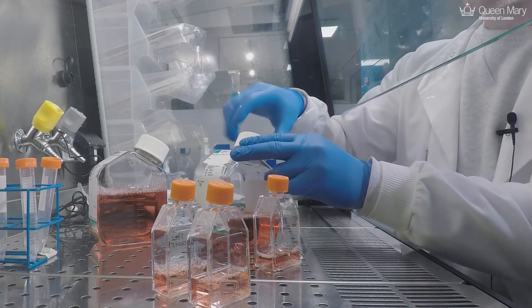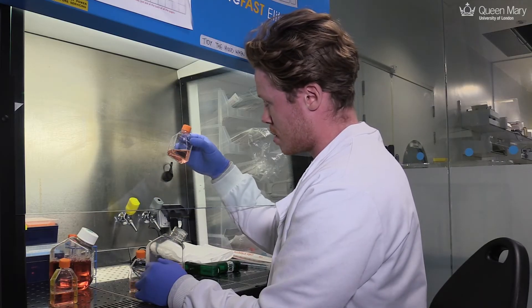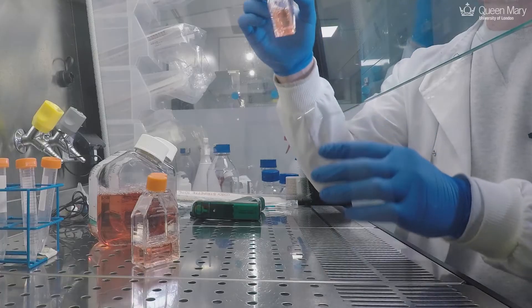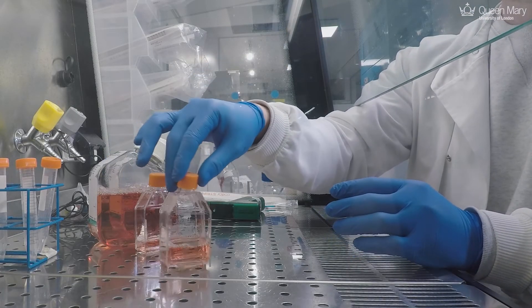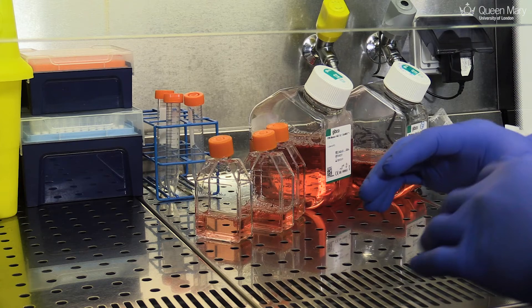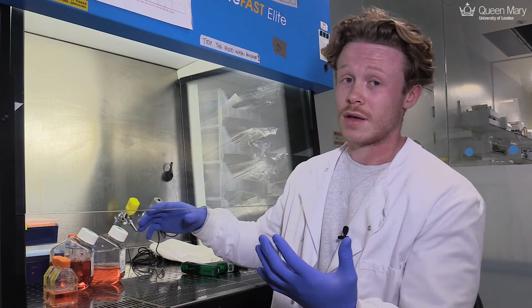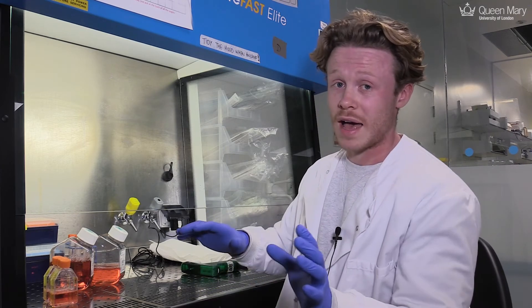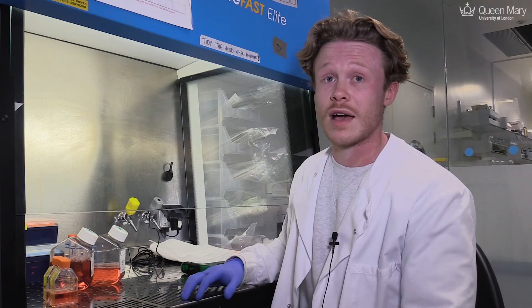So then what we do is we just give them a little bit of a tilt. And then we will pop these in our incubators which are set at 37 degrees for 48 hours, and the stress cells will then be exposed to nutrients with some restriction. Whereas our controls will grow healthily and normally, and we'll look at the differences in about 48 hours time. Thank you.